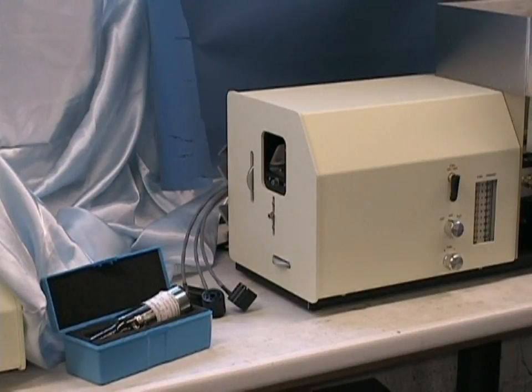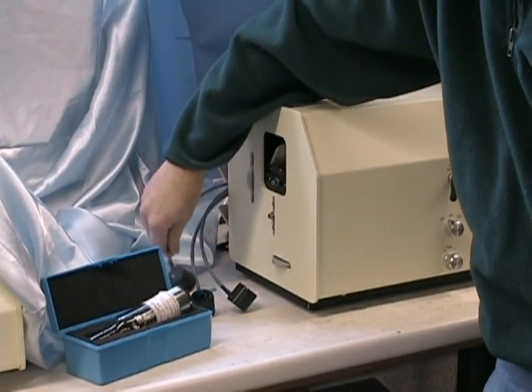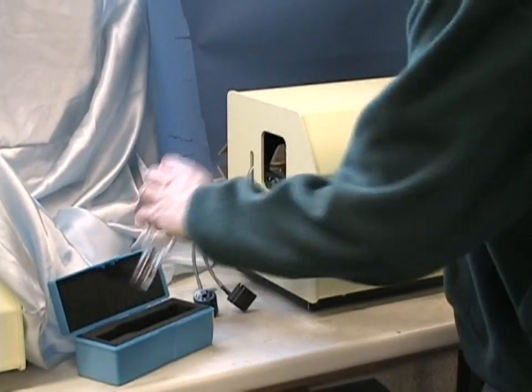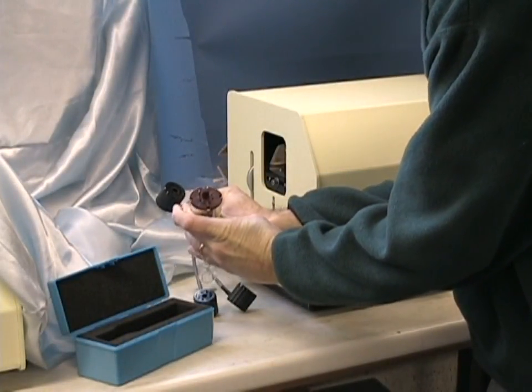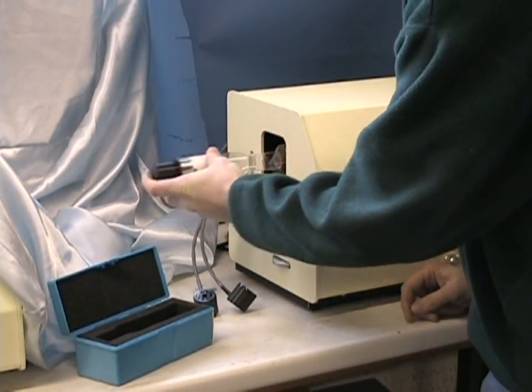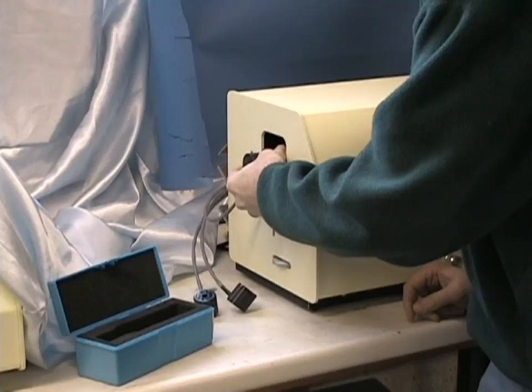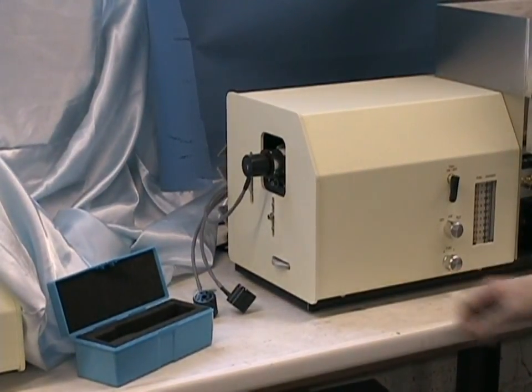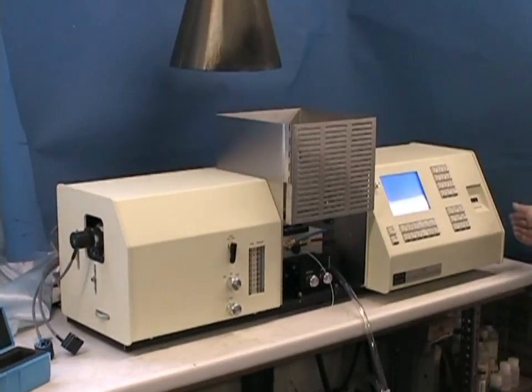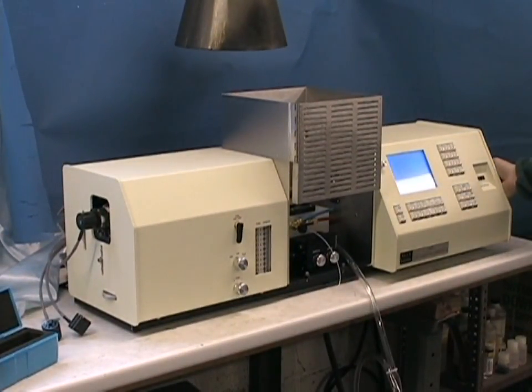The Buck 205AA system comes with three lamp power supplies labeled on the ends 1, 2, and 3. The socket has a keyhole to match the key in the end of the one and a half inch hollow cathode lamp. Be sure you have the right lamp socket based on the elemental file you've loaded. Insert the hollow cathode lamp and insert it into the spring-loaded clip on the left side of the instrument. At this point we are ready to go to our alignment screen. Press the align key and begin to optimize the energy of the hollow cathode lamp by fine-tuning the wavelength and looking at the bar graph signal or the energy number reading to maximize this energy.